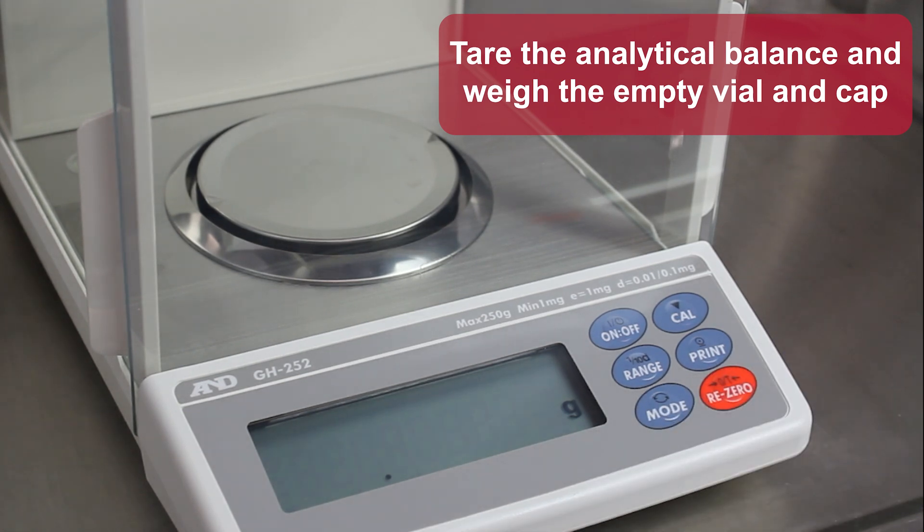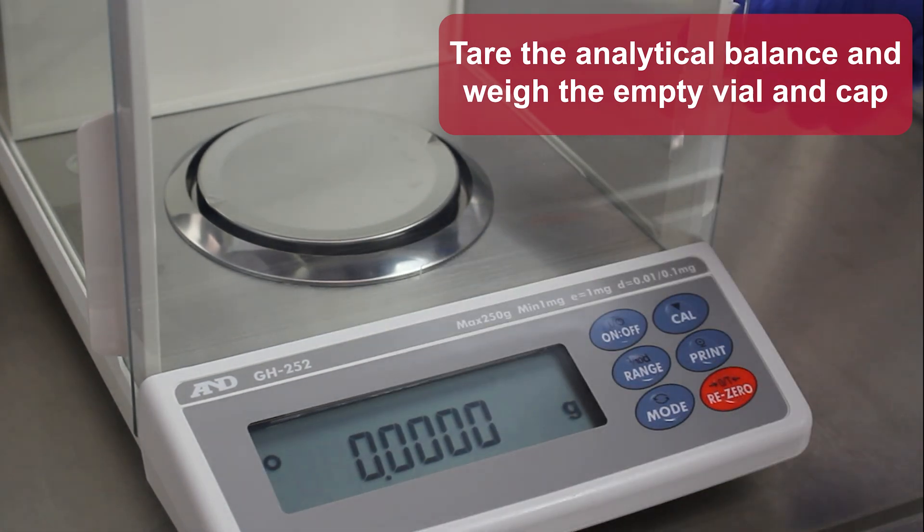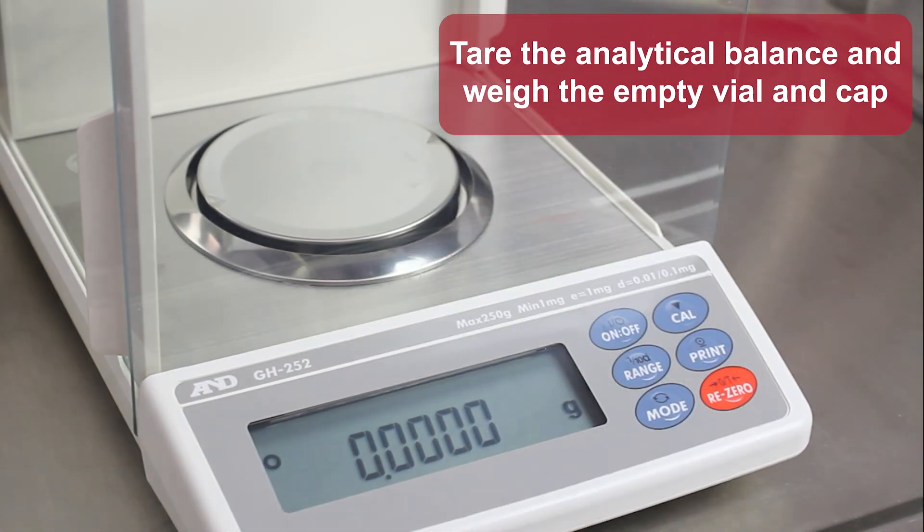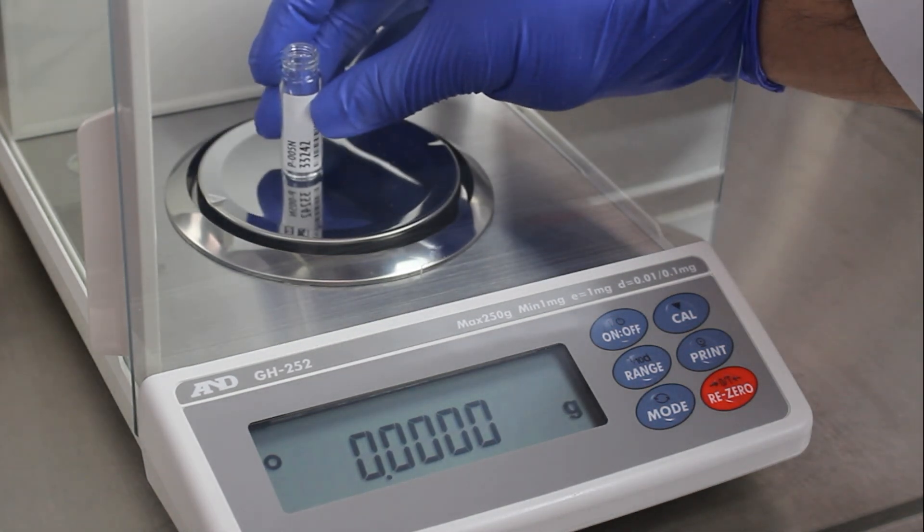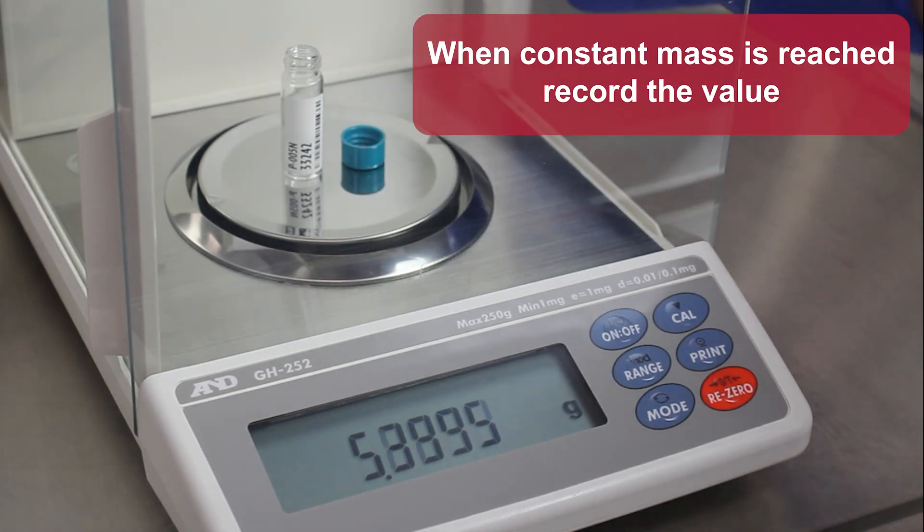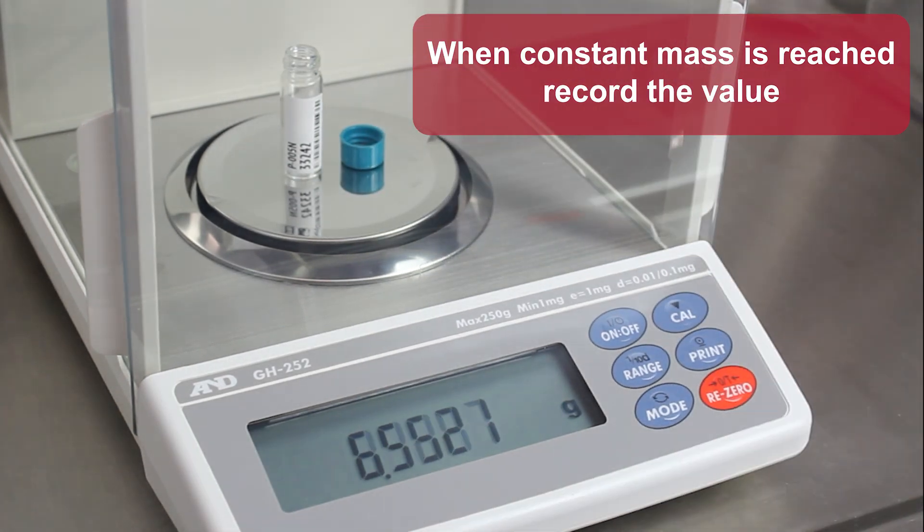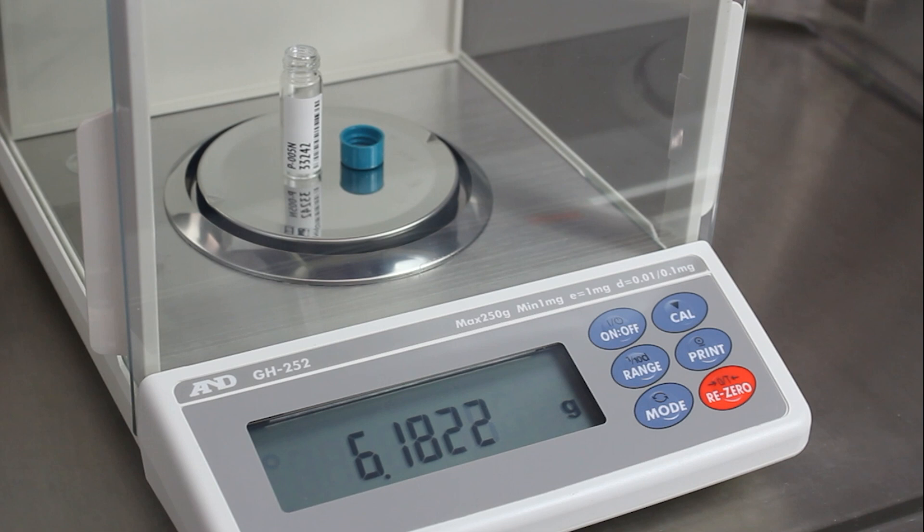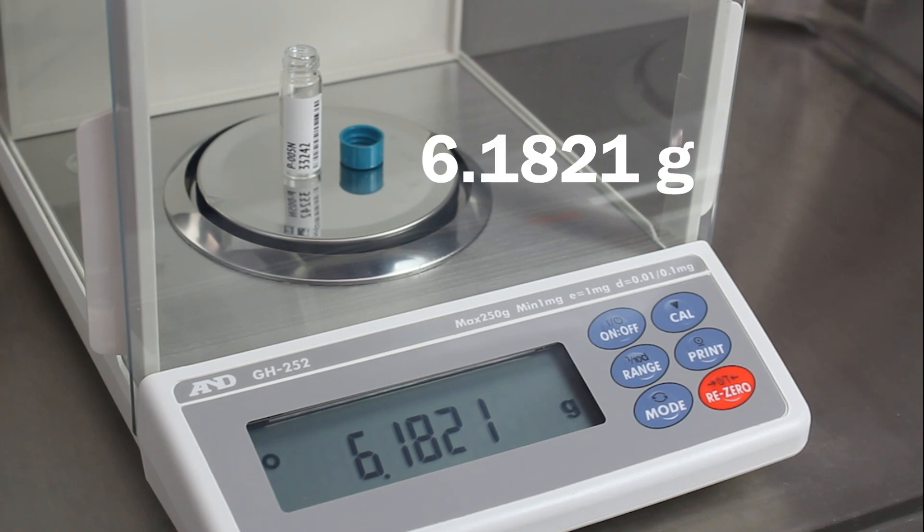Tare the analytical balance and weigh the empty vial and cap. When constant mass is reached, record the value. Here's the empty vial value.